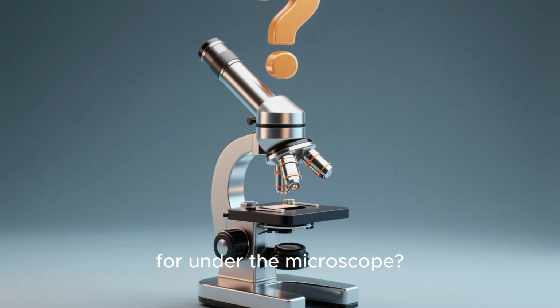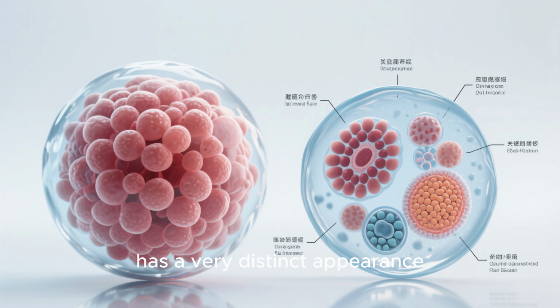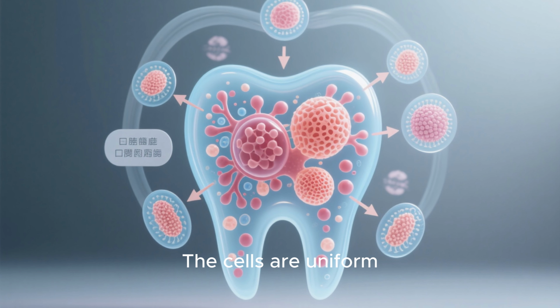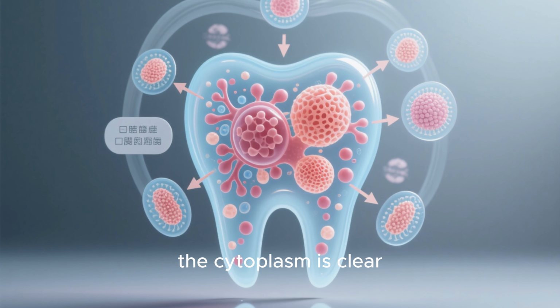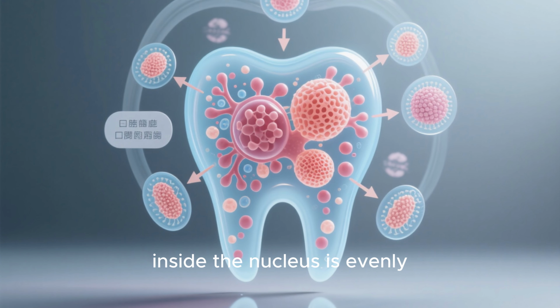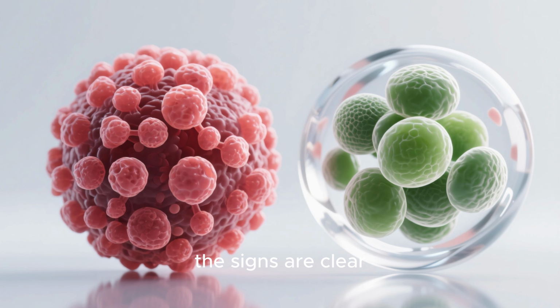So, what are we looking for under the microscope? A healthy oral cell sample has a very distinct appearance. The cells are uniform, the nuclei are small and regular in shape, the cytoplasm is clear, and the chromatin inside the nucleus is evenly distributed. But when things go wrong, the signs are clear.